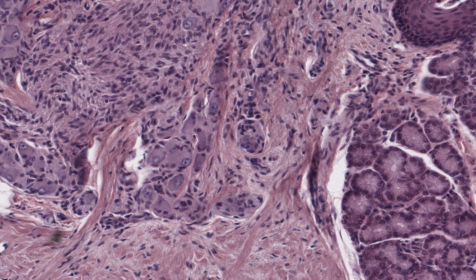If I asked you, how did I know that this was not a sympathetic ganglion? Your answer should be that the neuron cell bodies are clearly located within an organ or tissue, in this case the tongue.